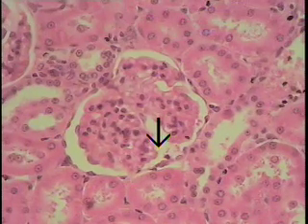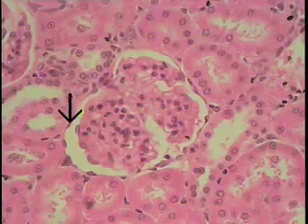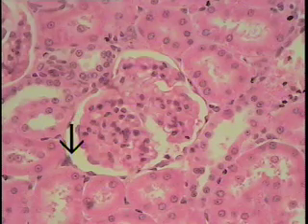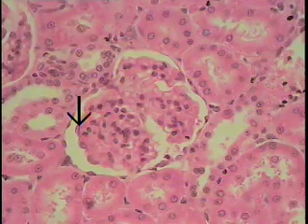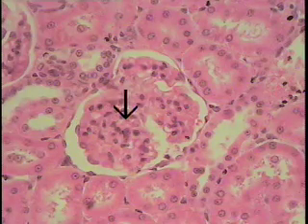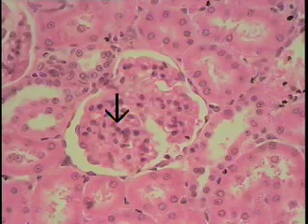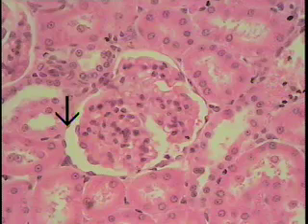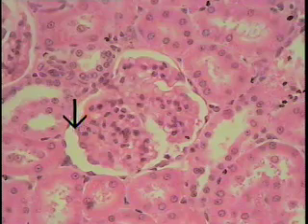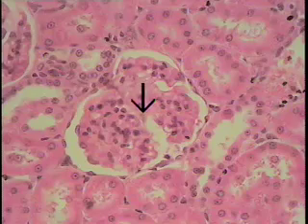Another example of a renal corpuscle shows the parietal layer of Bowman's capsule here — that simple squamous epithelium and capsular space. Here you can see quite well the visceral layer of Bowman's capsule: right here are these three cells. These other nuclei are, I'm quite certain, endothelial cells making up the glomerular capillaries. So we can see the parietal layer and the visceral layer of Bowman's capsule, separated by the capsular space, and then the glomerular capillaries shown in the remainder of the field.